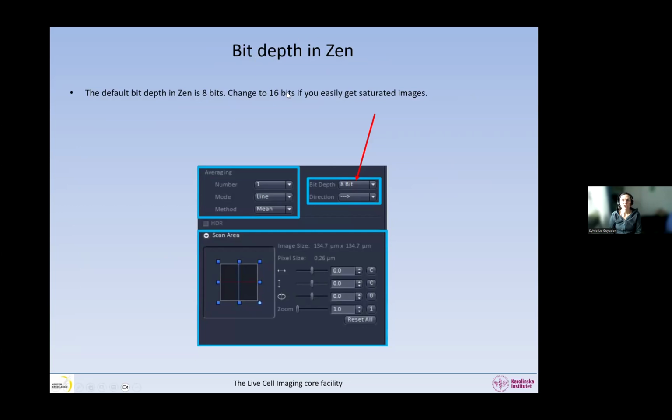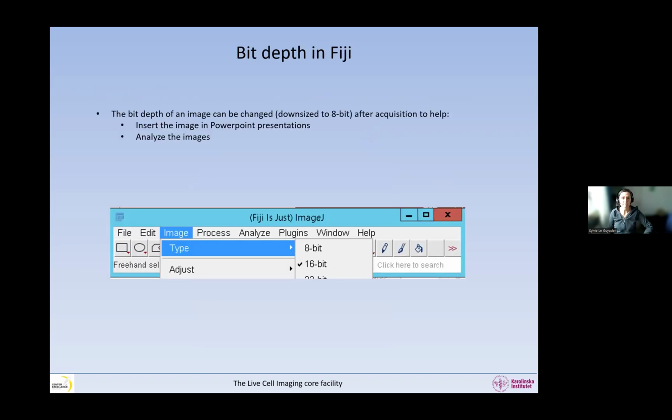Just to do a quick round in Zen, in the Zeiss software, this is where you find the bit depth. It's just above the scan area, and you can change it here. In Zen, the default bit depth on single point confocal is 8 bits, and you can change it to 16 bits if your sample is such that you quite easily saturate it. And we'll talk about when this happens. In Fiji, you can also find the bit depth under Image, Type, and this is where you can also change the bit depth.